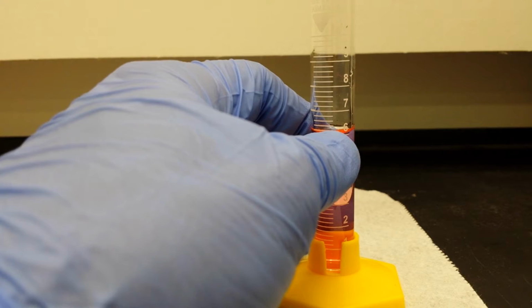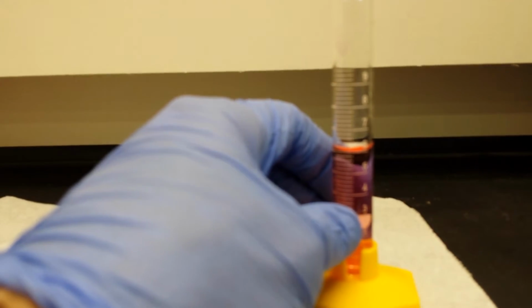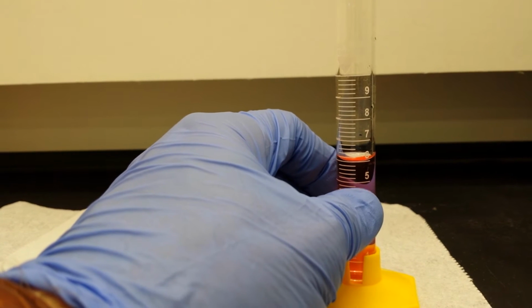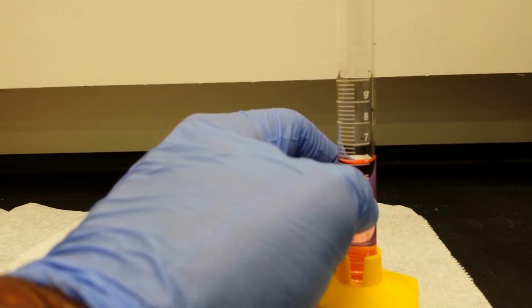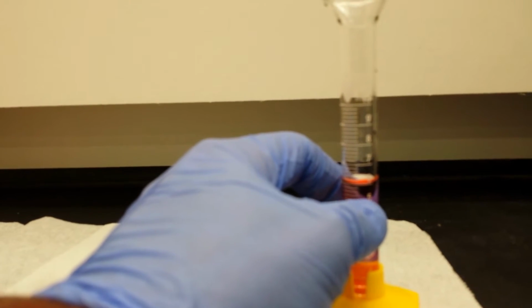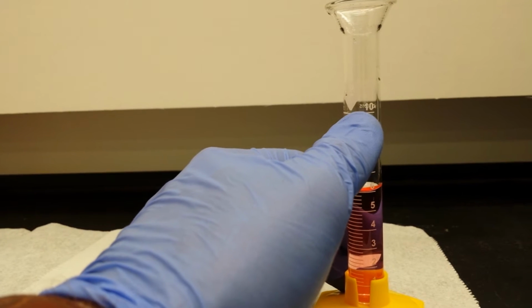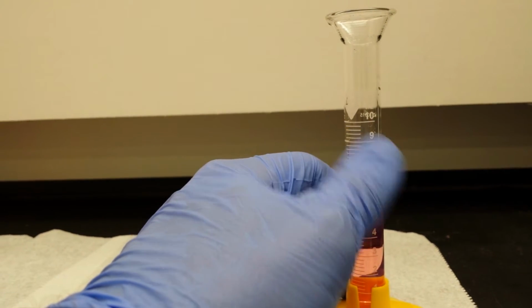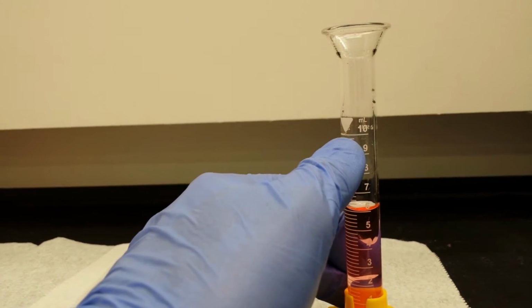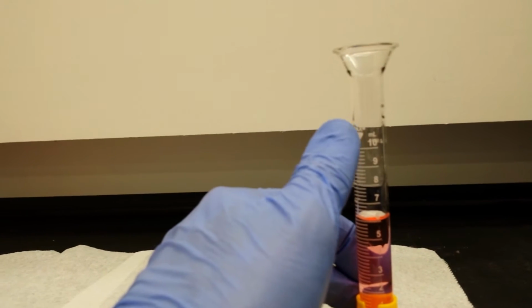Notice there's only 5 markings between our milliliters, which means that this graduated cylinder will only let us distinguish the whole value, and then we can estimate the decimal place. So we get our ones place, we get our decimal place. So for most of this, we get 2 sig figs at the very top line. Technically we could get a 3rd sig fig from the tens place, but that shouldn't be very significant because that's just bumping up a tiny bit.